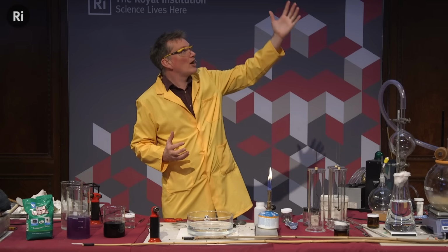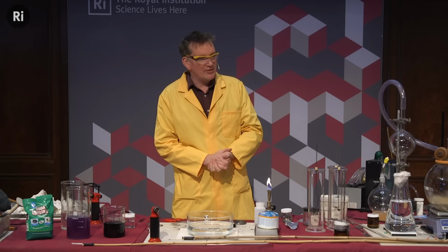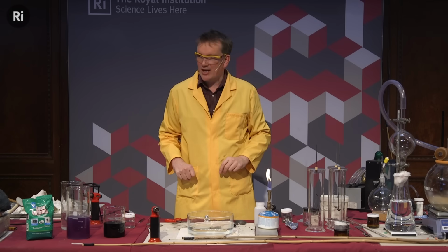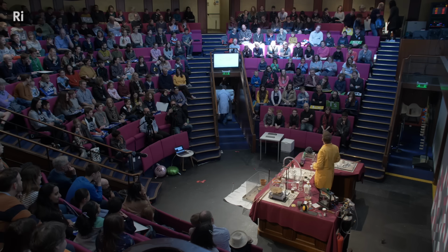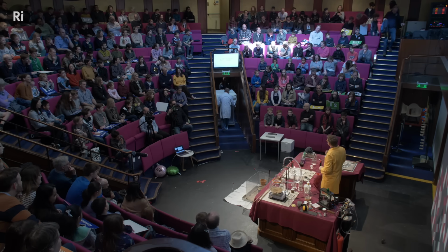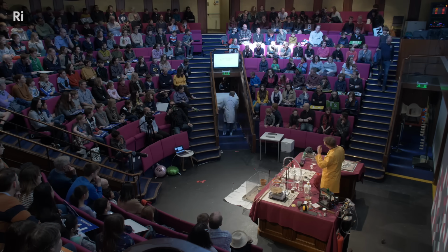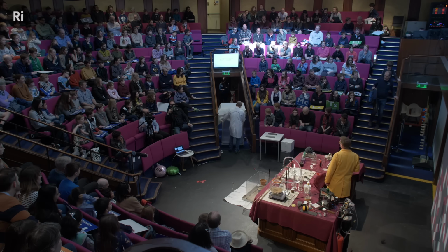But all of our group 1 elements, apart from hydrogen, which is a gas, they all react with water in this same way. Now, that was a little bit disappointing. We couldn't really see what was going on there. Should we try a larger piece? What do you think? Should we try a larger piece? Okay, right. Okay, so Chris there, I think, has a special piece of apparatus designed to do this reaction safely.